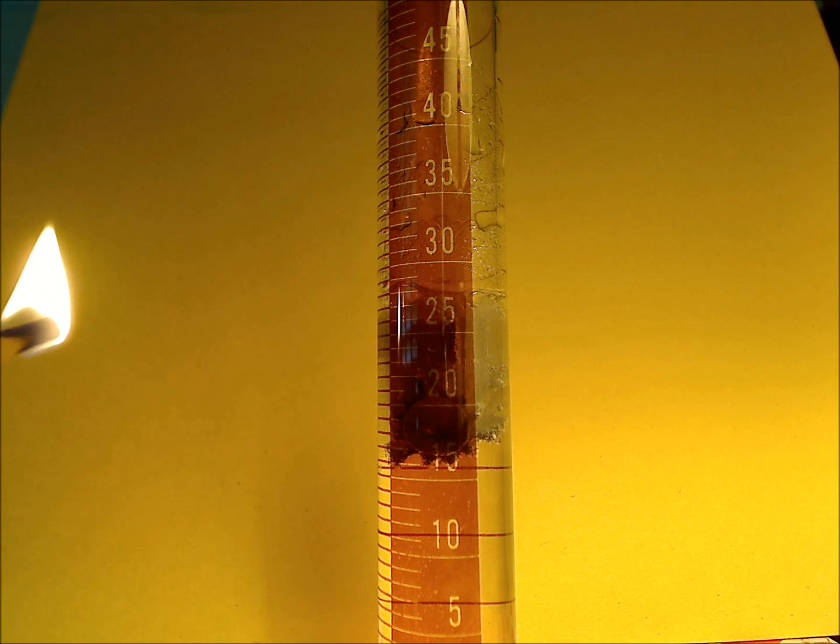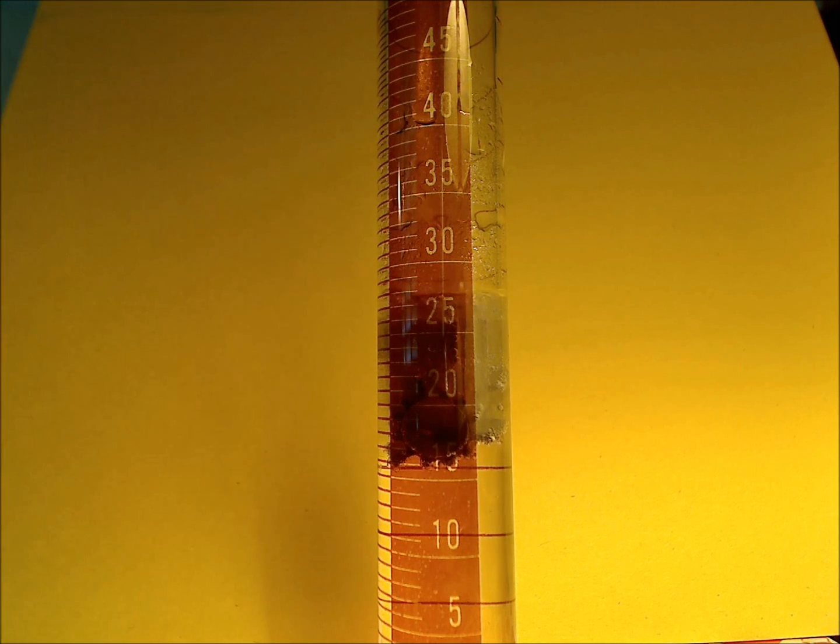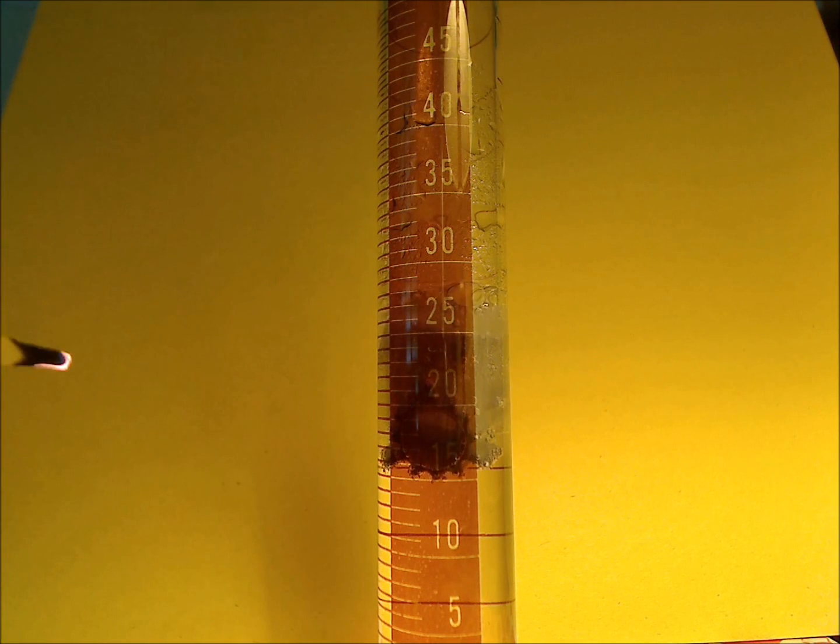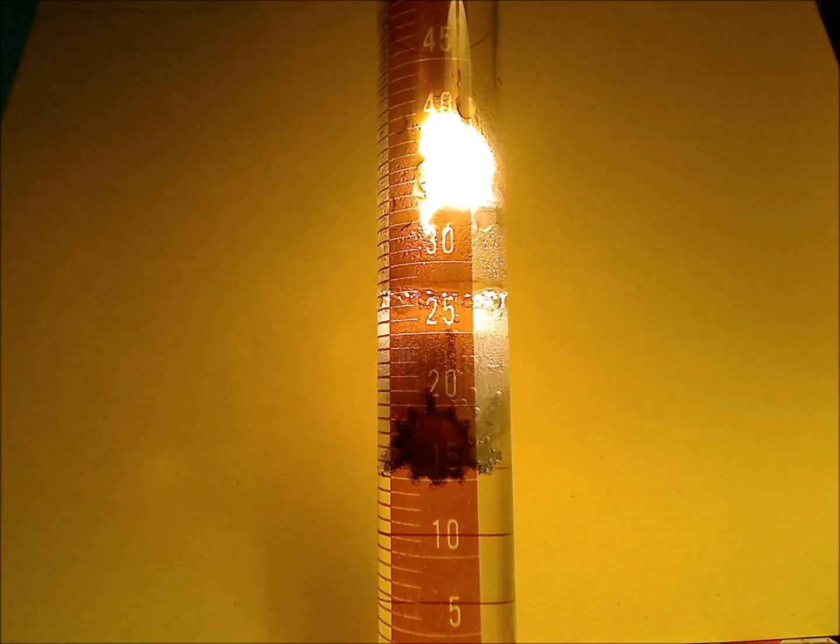You can see the flame. Now I'm going to blow out the flame. You can see the flame is glowing. And now I'm going to introduce the glowing splint into the container and it bursts into flame.